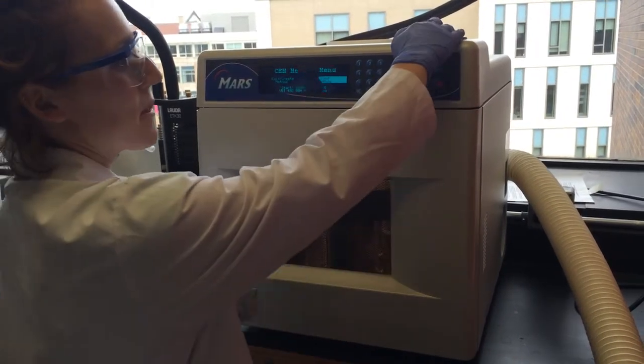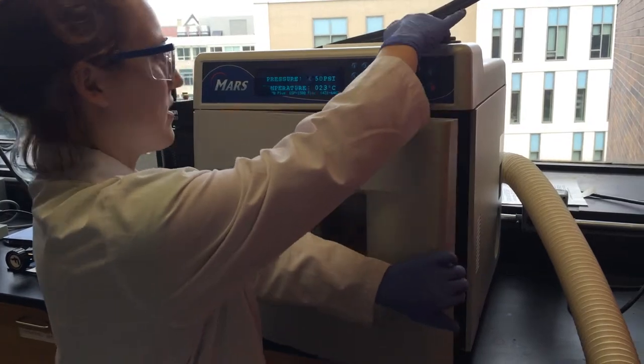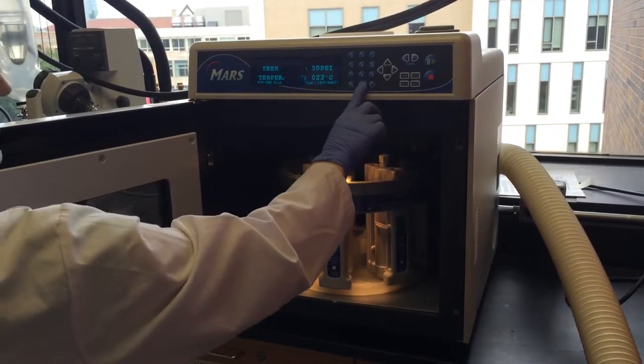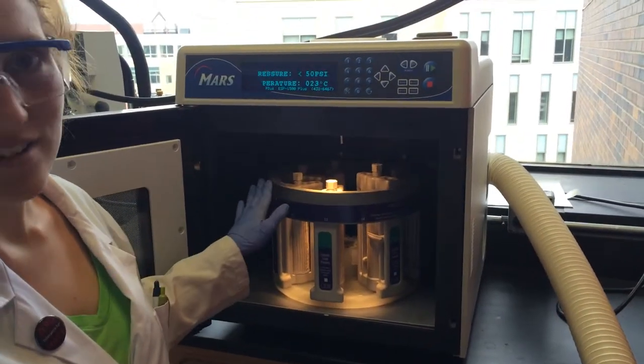Once the run is over, you can open the microwave door. If you press zero, the loud sound stops.